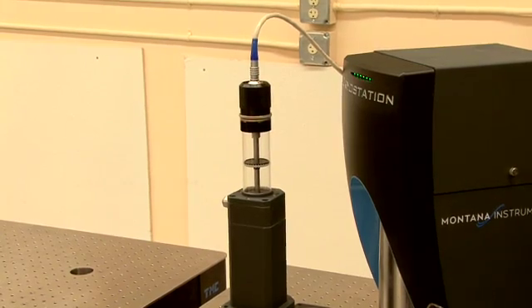Once the sample is cold you can exchange the sample by taking out the sample rod and placing a new sample on. To do this first pull a vacuum and then apply heat to the sample. Once the sample is between 150 and 200 Kelvin you can start flowing helium. This will reduce the mixing of air and helium as you pull the sample rod out.